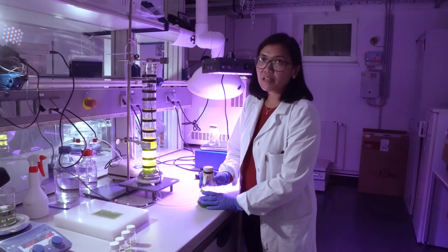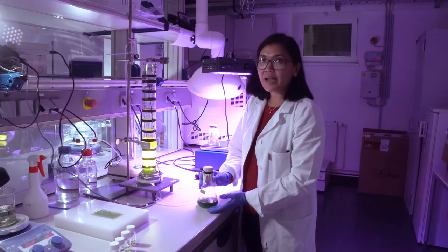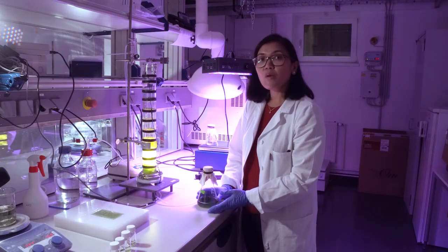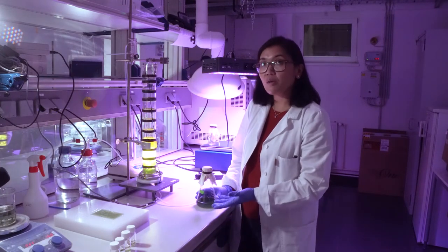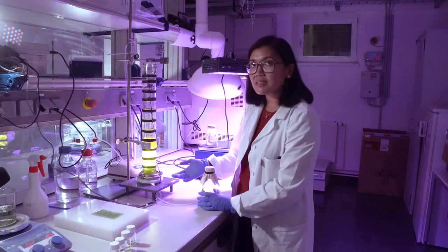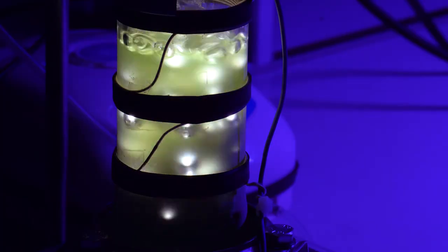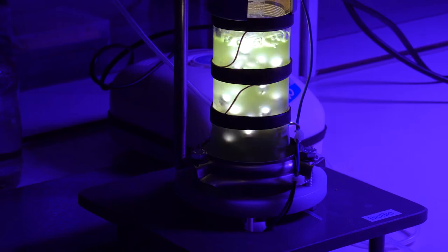In our lab, we have two reactor systems. One is a smaller one, which has a reaction volume of just 1 ml or 5 ml. This one is a 200 ml reaction mixture, but you can definitely go into a larger volume if you like.